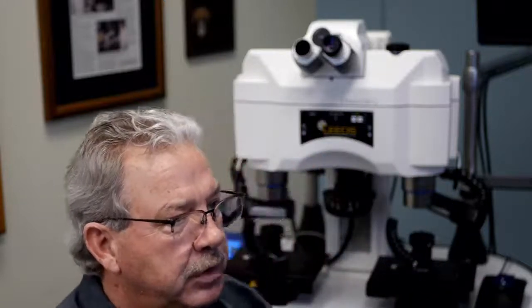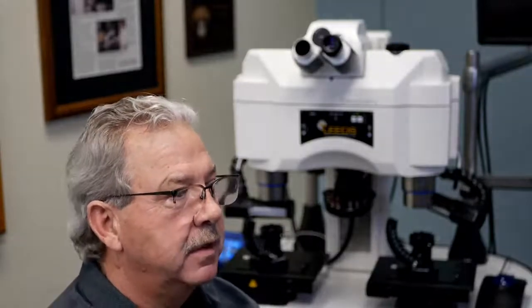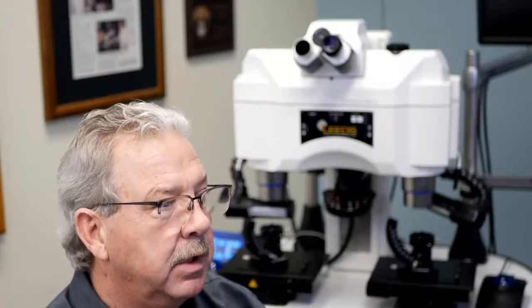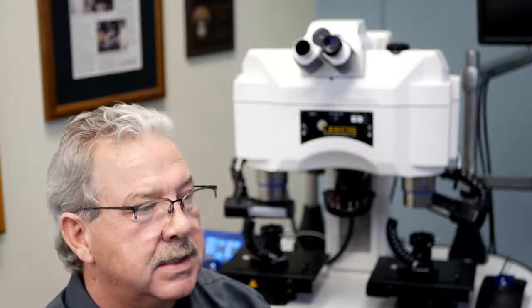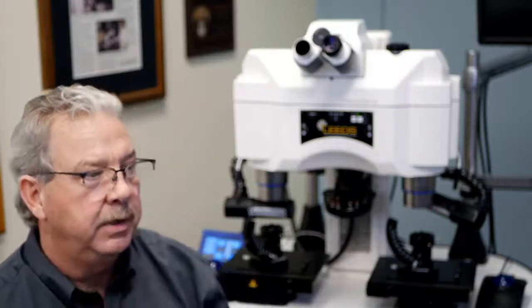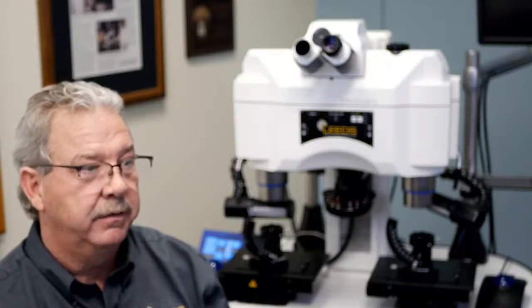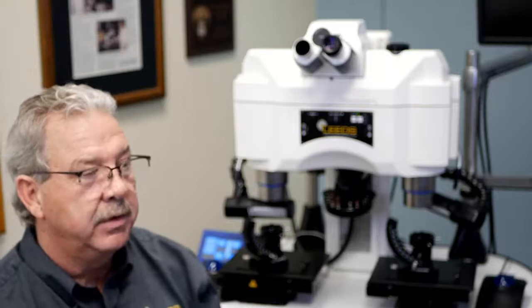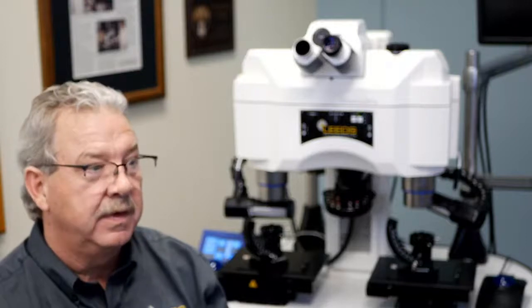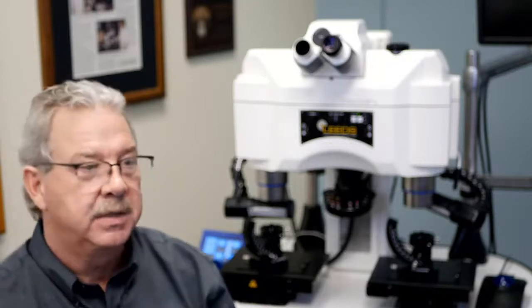So you can see we go from 254 square millimeters on the low end and 415 on the high end, meaning that the area of a 23mm field of view eyepiece is 63% larger than an 18mm field of view eyepiece. Rather dramatic. If I have to scan an area of a set size, I should in theory be able to do it 60% faster with the 23mm field of view eyepiece. I don't need to constantly be moving my stage. Okay?